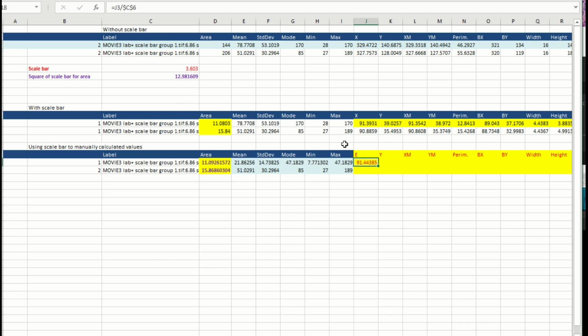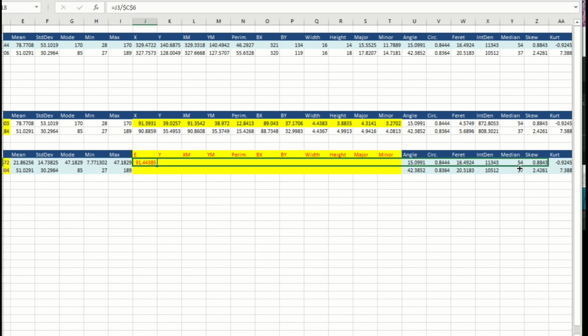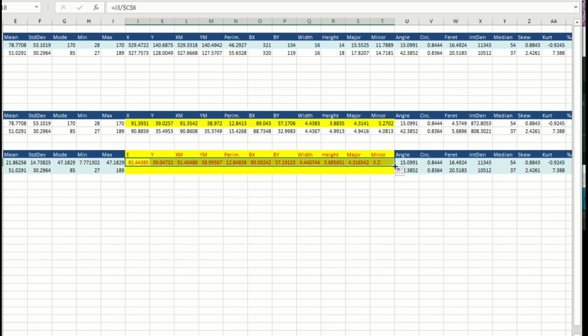Now I have this one. As this one doesn't have a dollar symbol, it is going to move when I drag the values, and this one is not going to move because I have dollar symbols before the C and before the 6. So look, I drag it down, and here I'm going to have this value, and if you see, 38.97 is very close to 38.99.